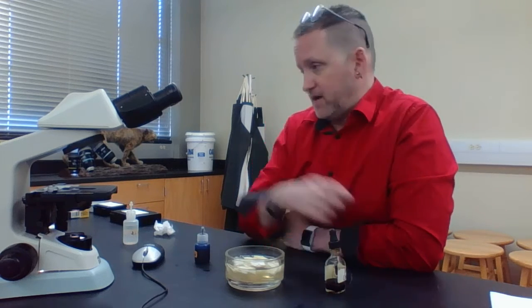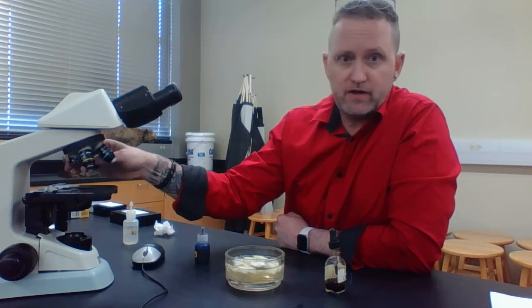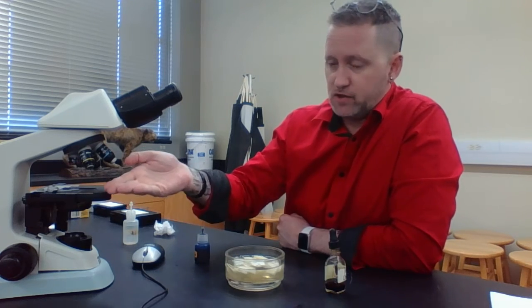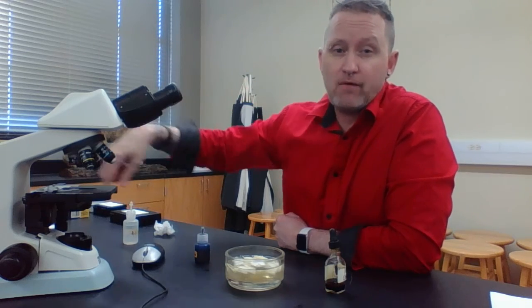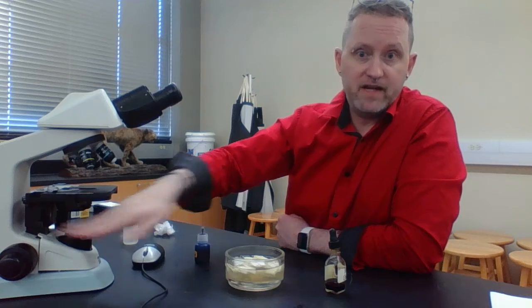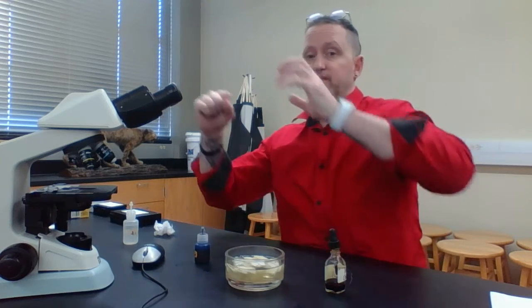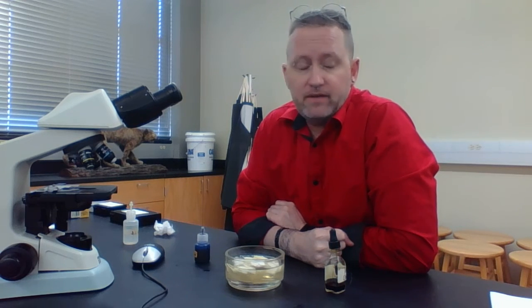Now, when you're done, make sure your microscope is off. Make sure you're under your scanning objective. Make sure that your stage is furthest away from your objective. Wrap the power cord, not too tightly or too loosely, around underneath the stage. Put the protective covering back on and then stick it back where you found it.